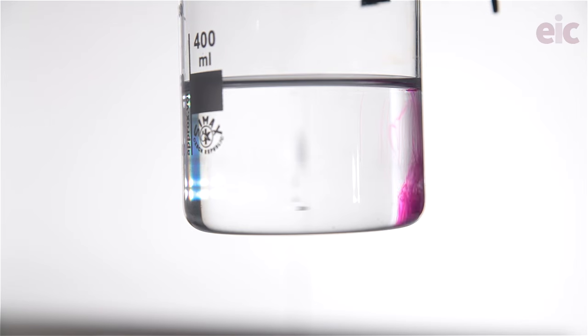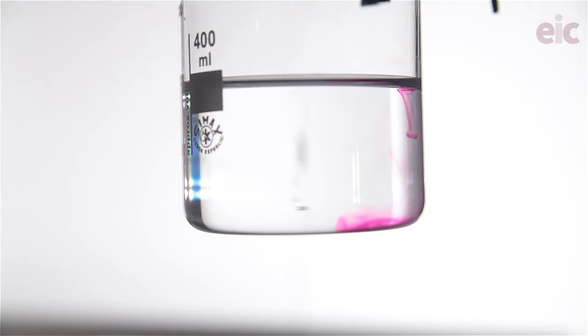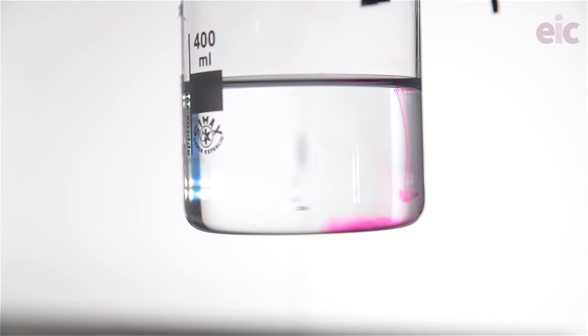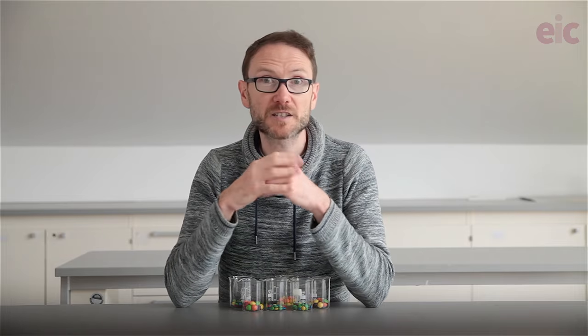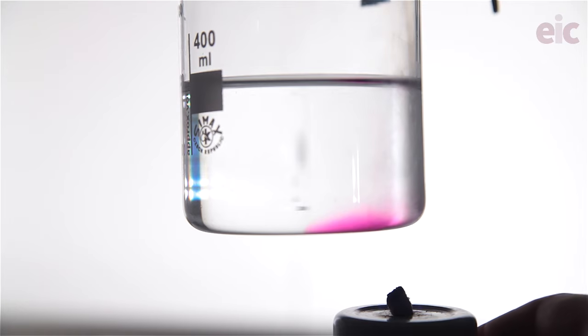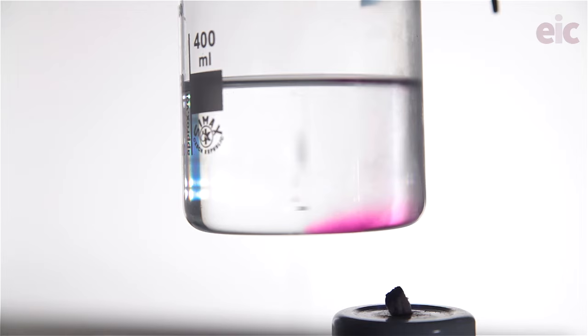In a long lesson you can see the purple color from a crystal of potassium manganate 7 making its way through a beaker, but you can introduce some bulk fluid motion by changing the density of the liquid around the dissolving substance. Classically we do this by heating below the crystal to establish a convection current.